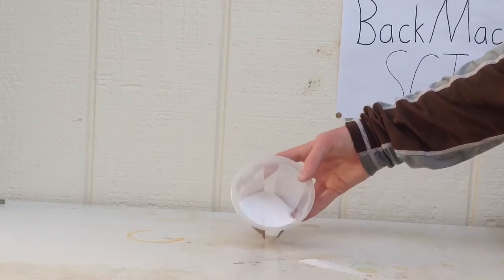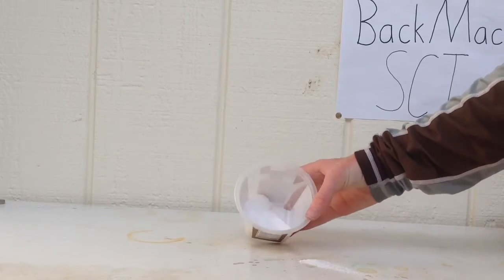This can be potassium nitrate, ammonium nitrate, or sodium nitrate.